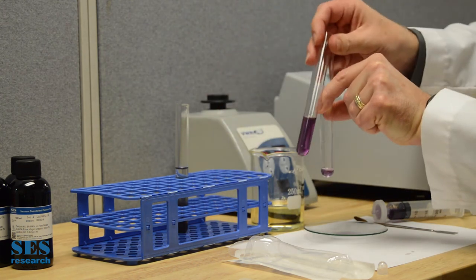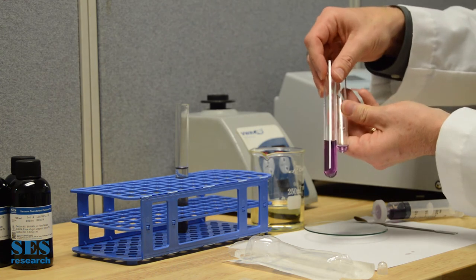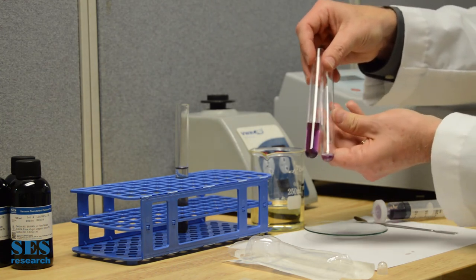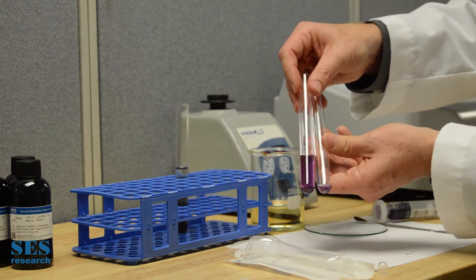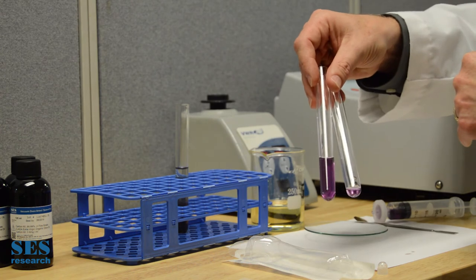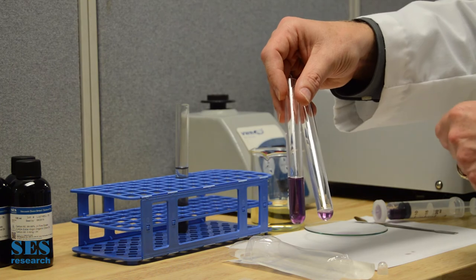You can see it's a little bit less solution, but you can see that's about the same color when it's up near the top — so that is the same color, actually. And when you see that, you can know that all of the C60 that was in the sunflower seed oil actually came all the way through in solution. So that should be a good shot of that.